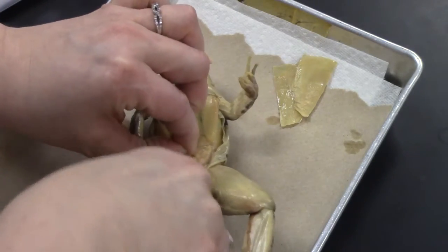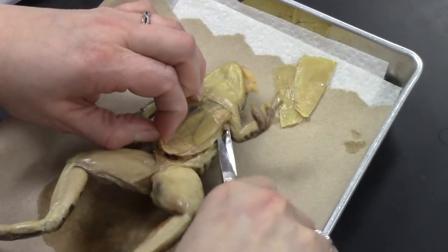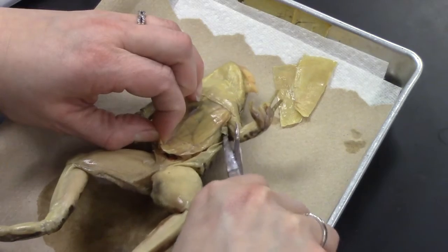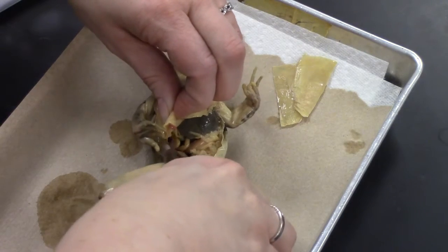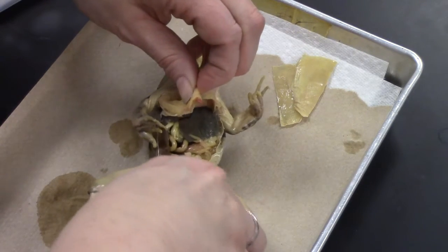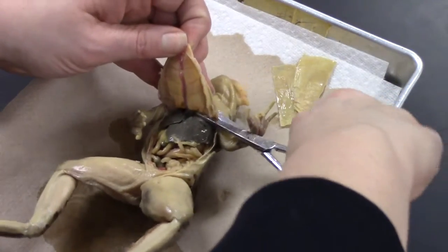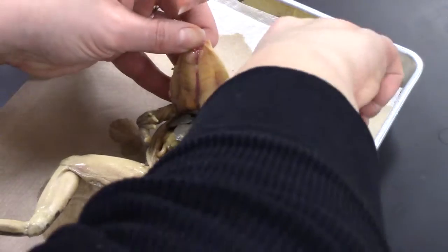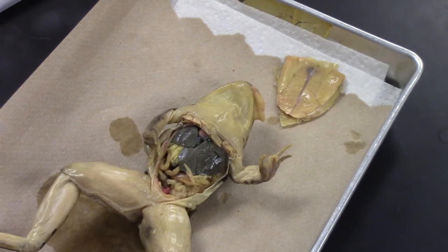If you want to cut down the middle you can; otherwise I'm going to follow the outside edge, make a flap, and keep cutting. The sharper your scissors are, the easier it will be. The first thing you notice upon removal of this flap is going to be the liver — the liver is that very dark area, and there should be several lobes or sections to the liver. To really get into the frog, you're going to have to move some stuff around, which is totally fine.